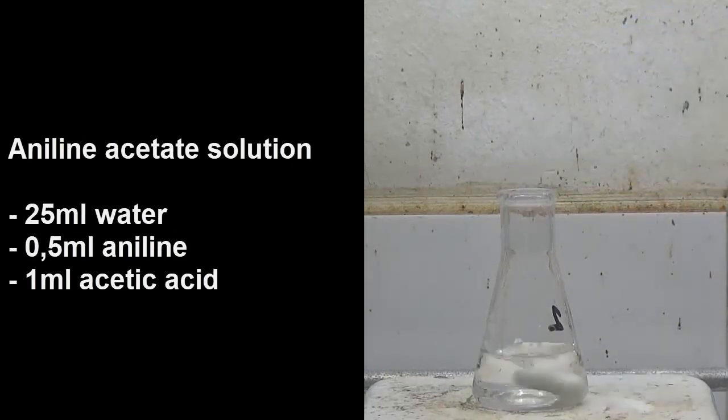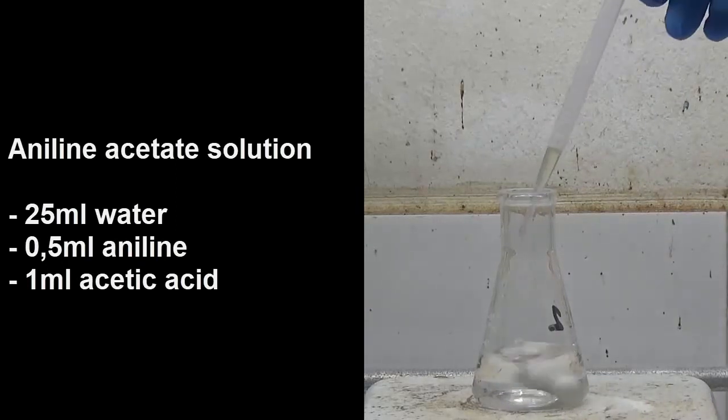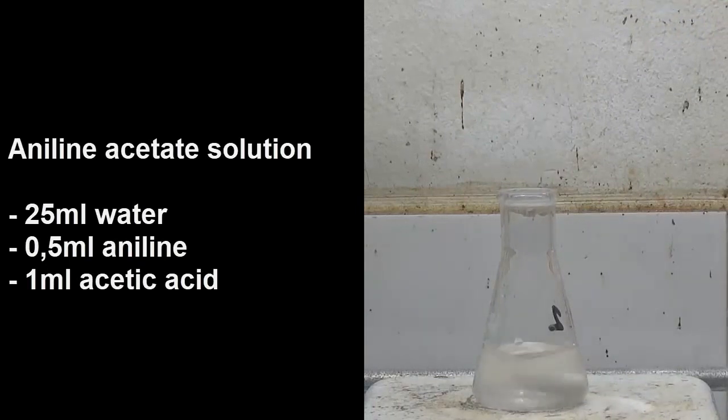The reagent is prepared by dissolving half ml of aniline in 25 ml of water with 1 ml of acetic acid.